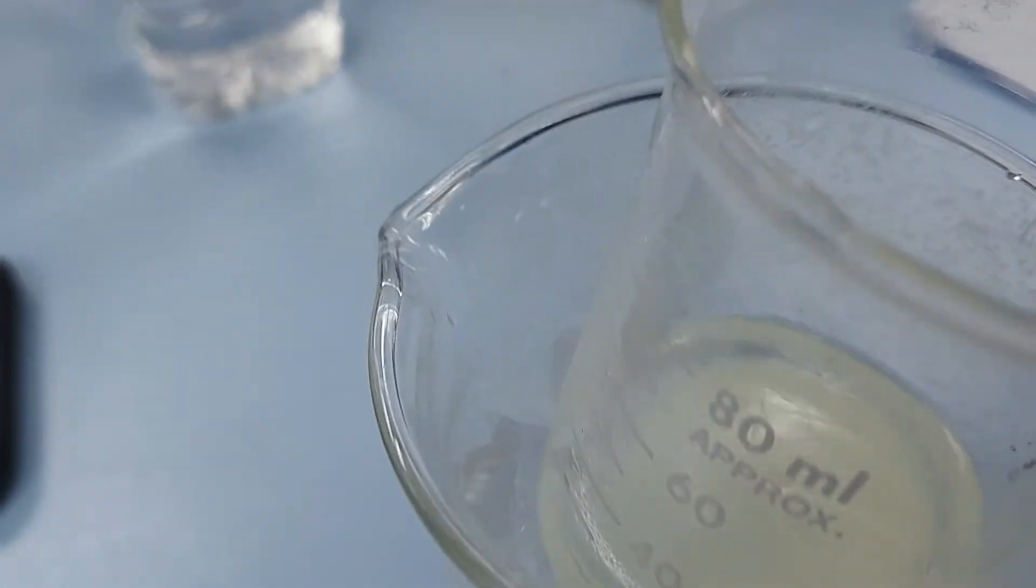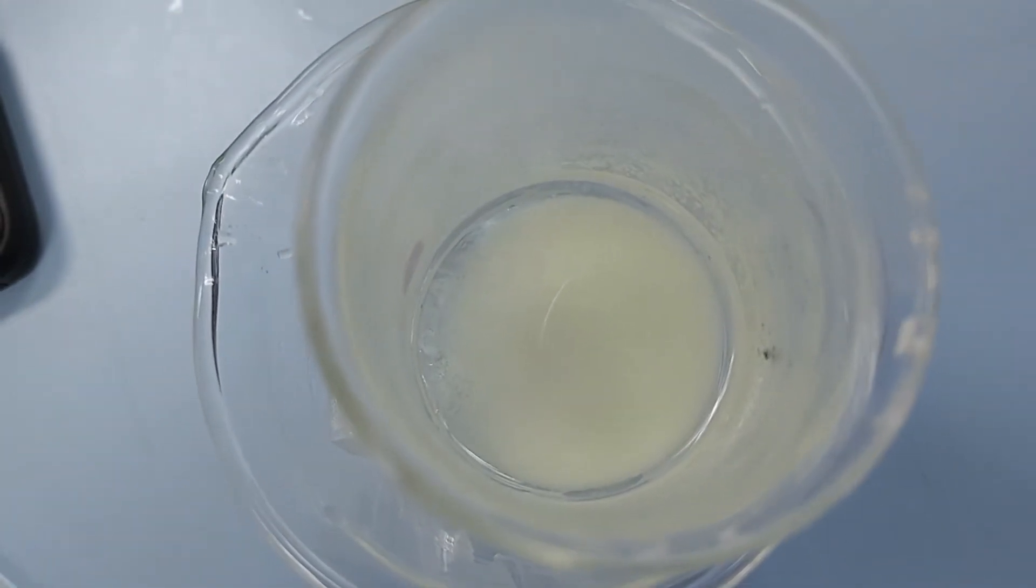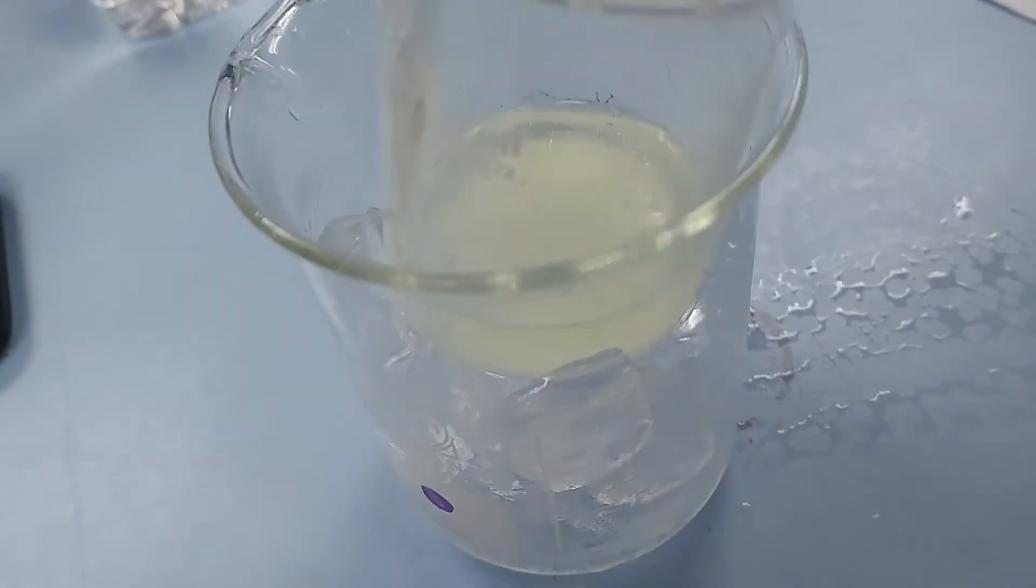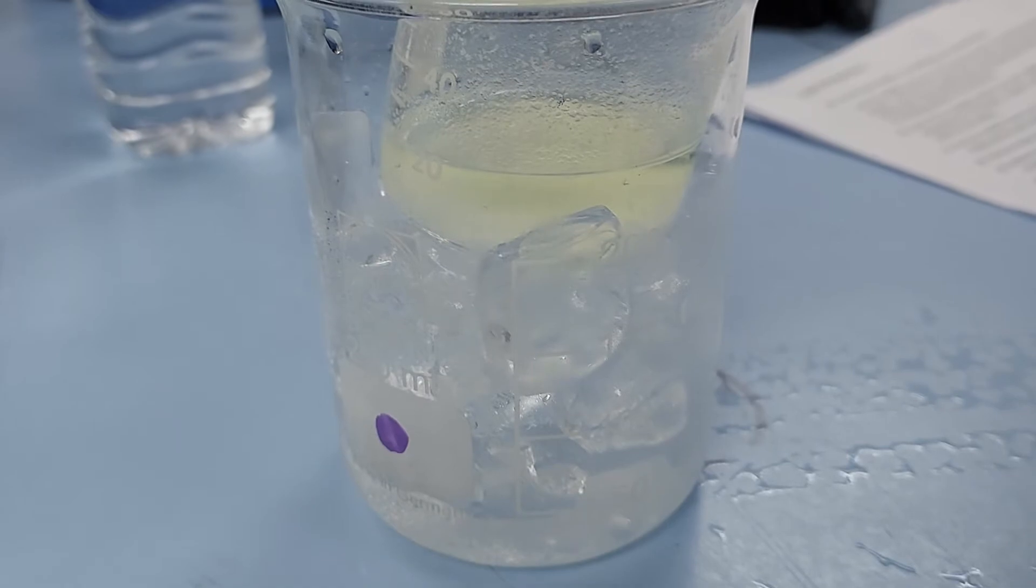So we can see here now the pure product has crystallized out and we're going to filter that again under reduced vacuum.